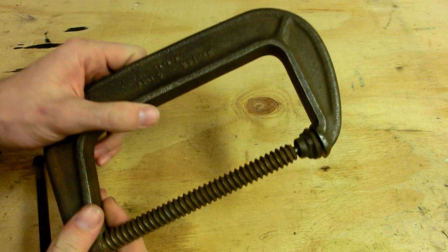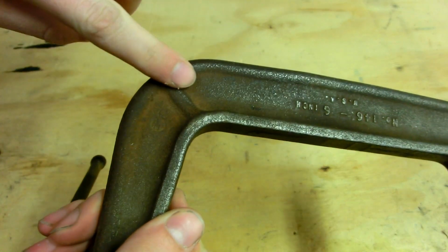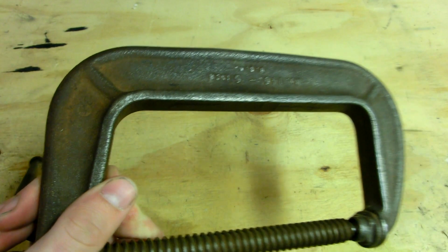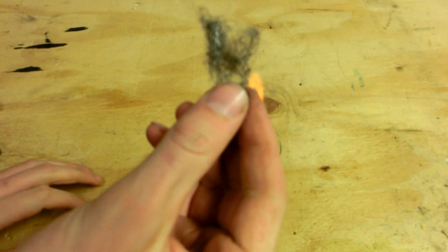Now, as you can see, this block of iron doesn't self-ignite in air. However, it is reacting with air. It is making iron oxide. Now, the interesting thing is, the finer we divide the iron, the more reactive with air it'll be.